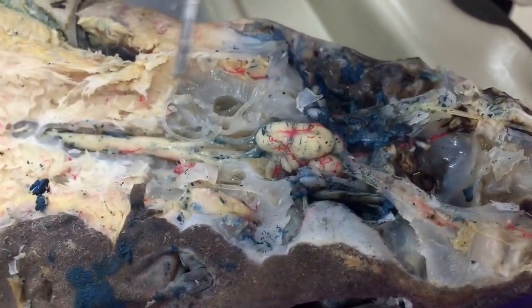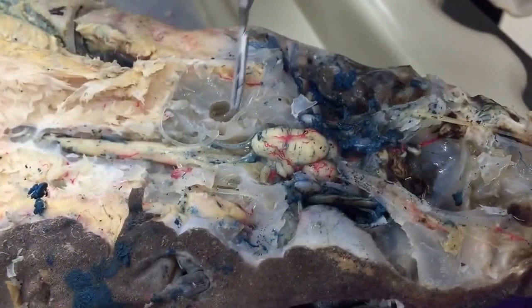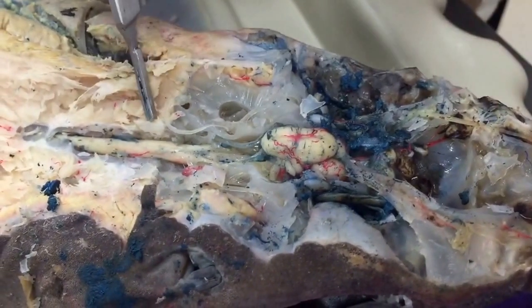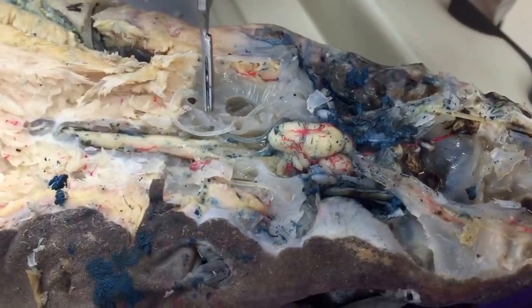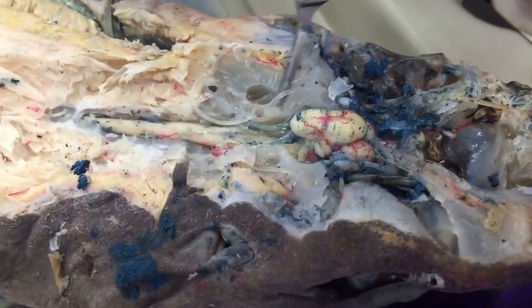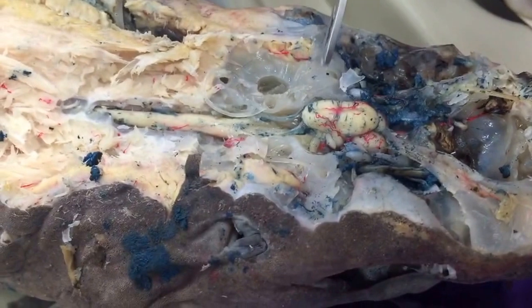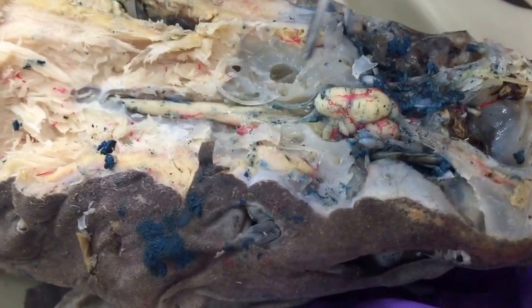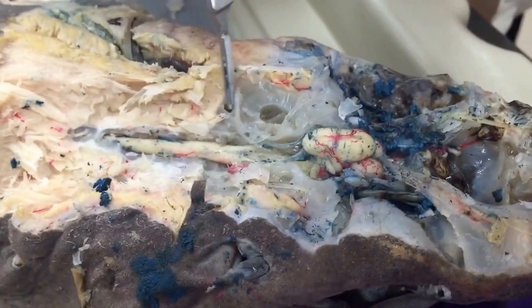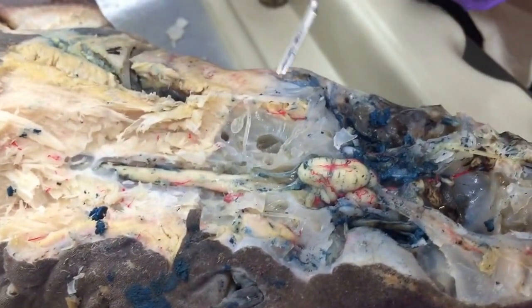And surrounding it on either side, the left and right side, are 3 semicircular canals. So this one we've actually pulled out of the groove that it sits in. Because this is the shark's left, this would be the left anterior semicircular canal. This is the left posterior semicircular canal that would sit in this groove here.